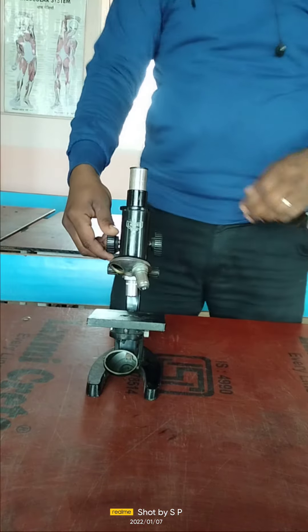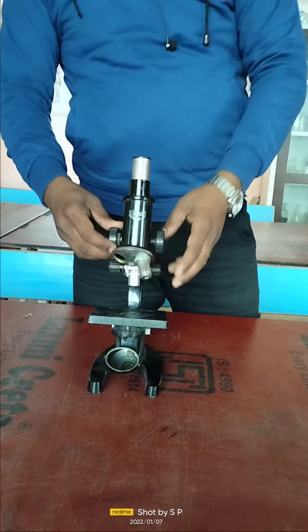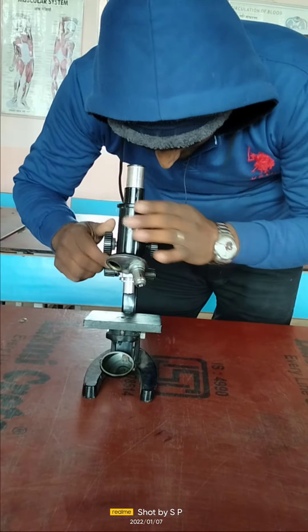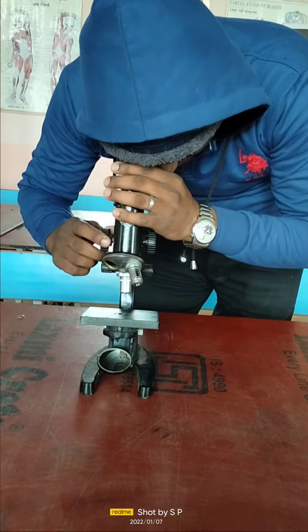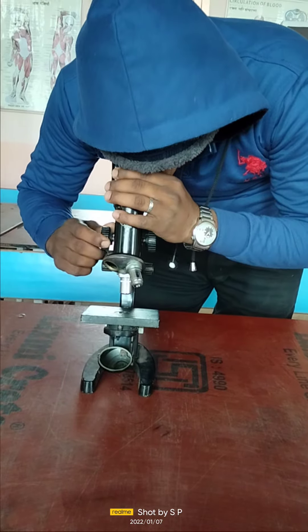We have to move this lens as per the best observance so that the specimen should be clearly observed from the eyepiece, like this we are going to set it.